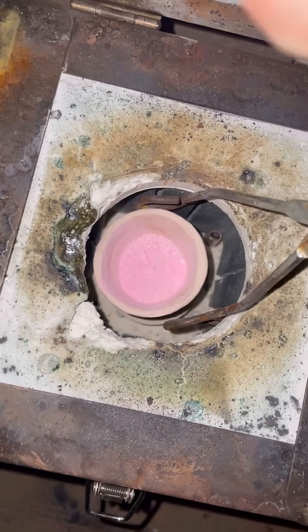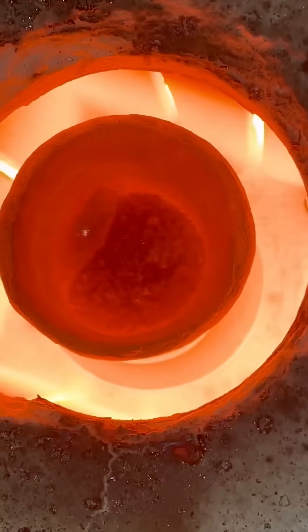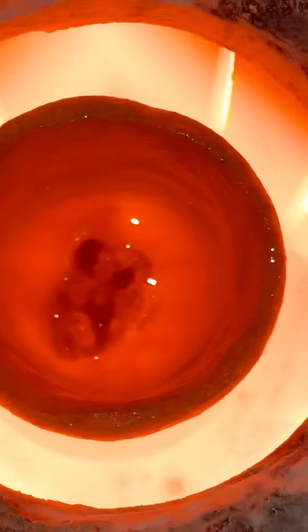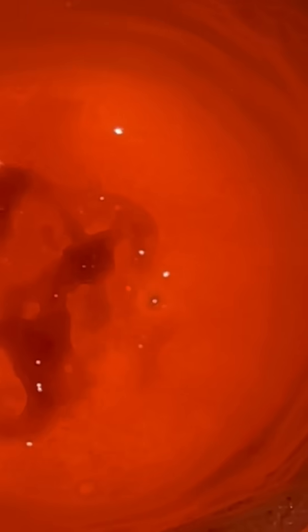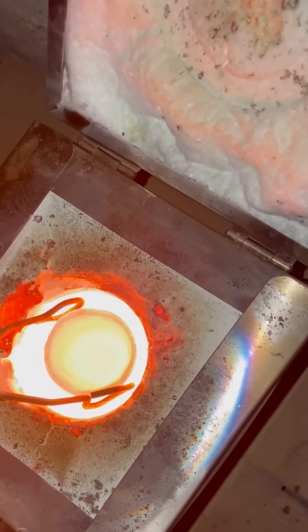And there we are. It's beginning to get melty. There's metal — that's a good sign. Looks like the excess carbon is slowly burning off. That looks like it's good, let's just take that out, set it in the sand, let it cool.